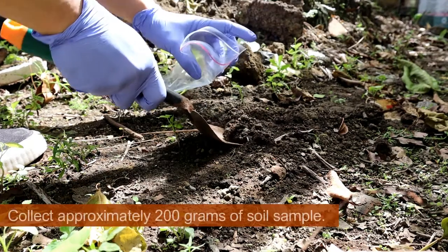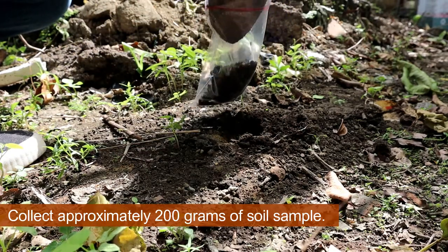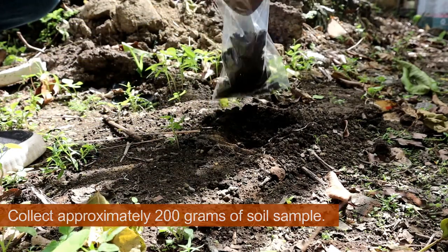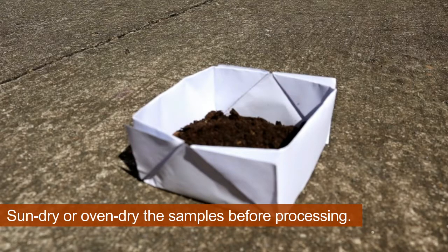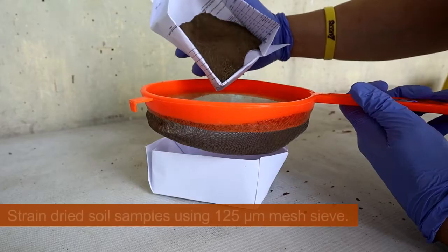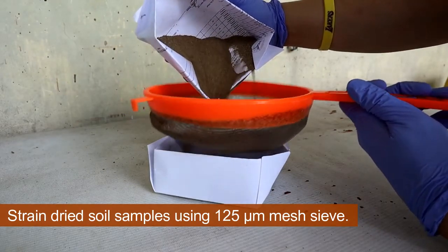Collect approximately 200 grams of soil sample. Sun-dry or oven-dry the samples before processing. Strain the dried soil samples using a 125 micrometers mesh sieve.